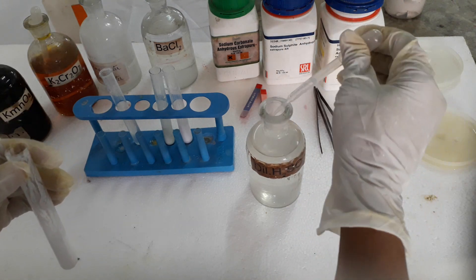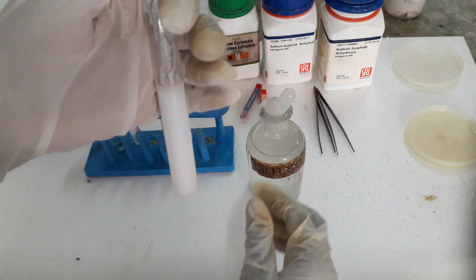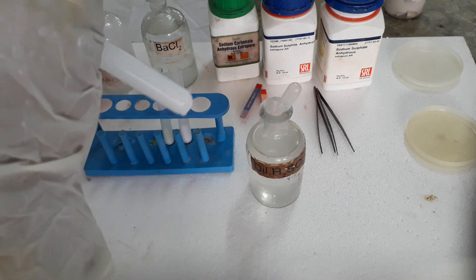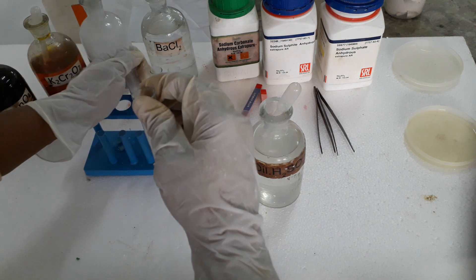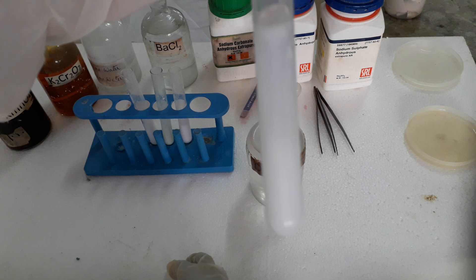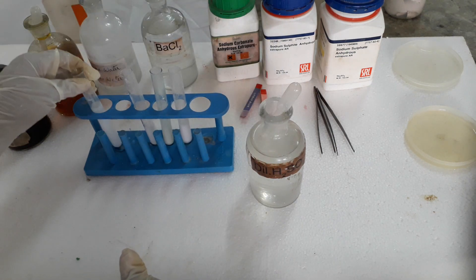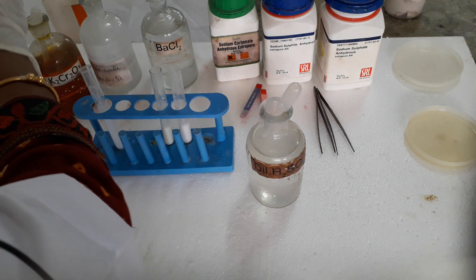With the first salt, sodium carbonate, on adding dilute sulphuric acid we get a brisk effervescence. We do not allow the gas to escape — we pass it immediately to lime water. See here, the lime water turns milky. Lime water is a saturated solution of calcium hydroxide. When carbon dioxide gas is passed through it, calcium carbonate is formed, and we say lime water turns milky — that is the test for carbon dioxide gas.